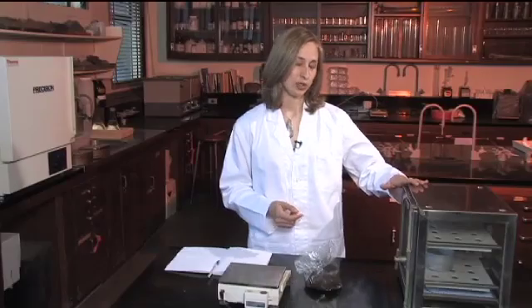You want to leave the samples in the oven long enough that they've come to a constant weight, usually 24 to 48 hours. After enough time has passed, you take them out and put them in a desiccator to cool down.